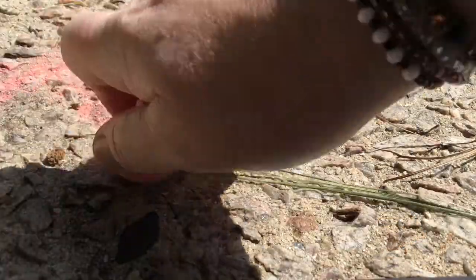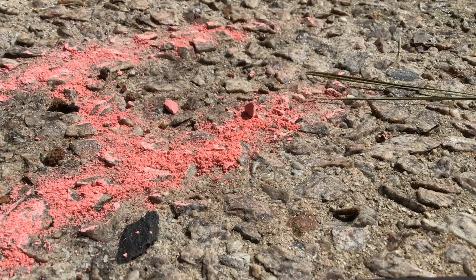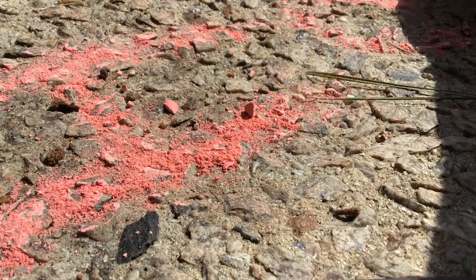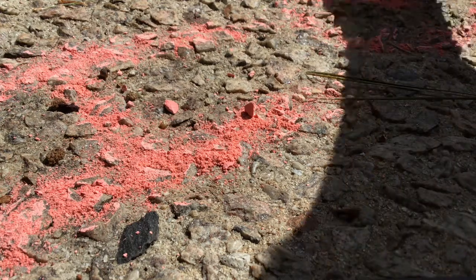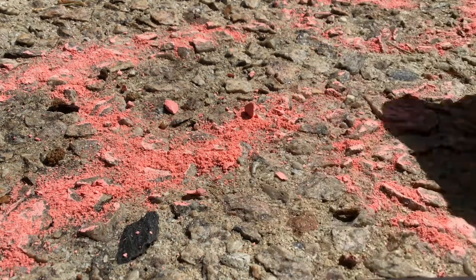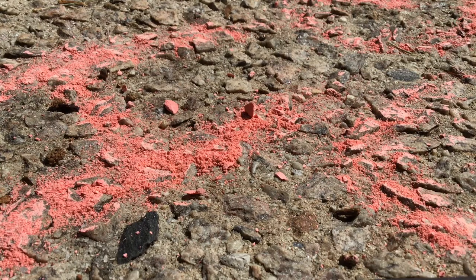So we're here outside using up some of our calcium carbonate, and I want to figure out how much calcium carbonate I am leaving on this sidewalk. I need to use at least enough so I can tell the difference in the weight. If you guys are doing this in class, you can write your name or anything else you want as long as it's polite. If you're doing this remote, we'll go back inside in a minute and I'll weigh this chalk again.